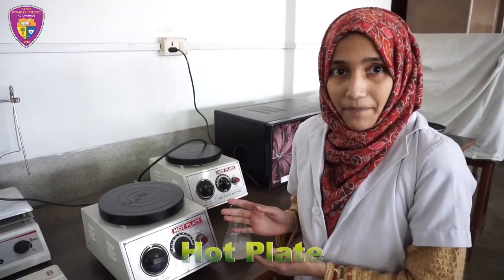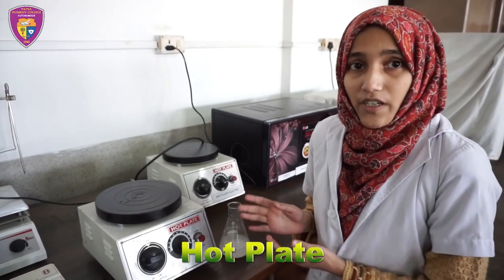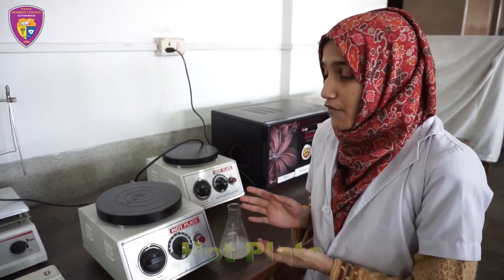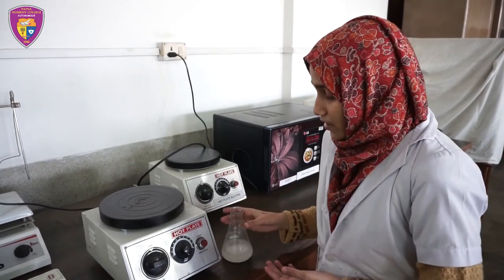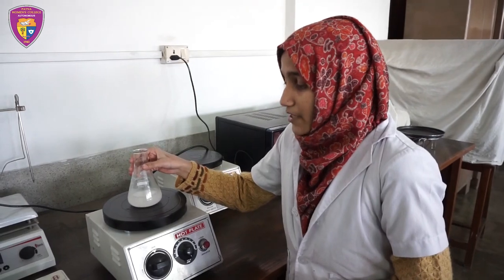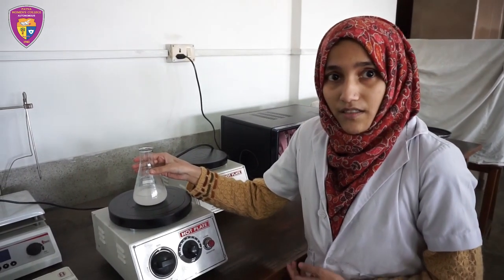Hot plate equipment. This equipment is used for heating a solution or medium for biochemical testing. Right now I am putting this sample for estimating calcium in milk.